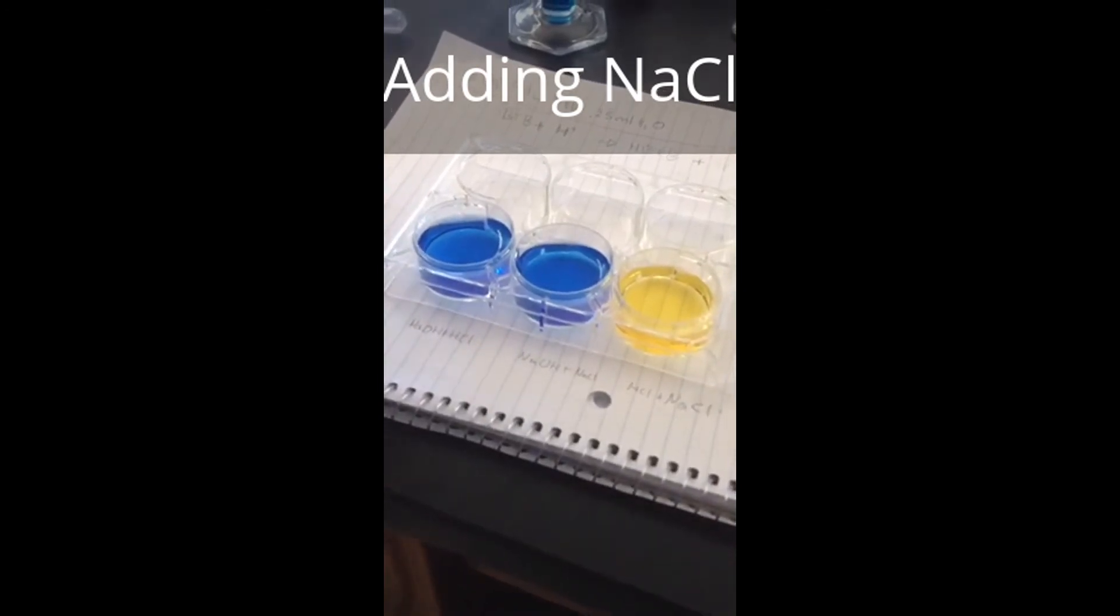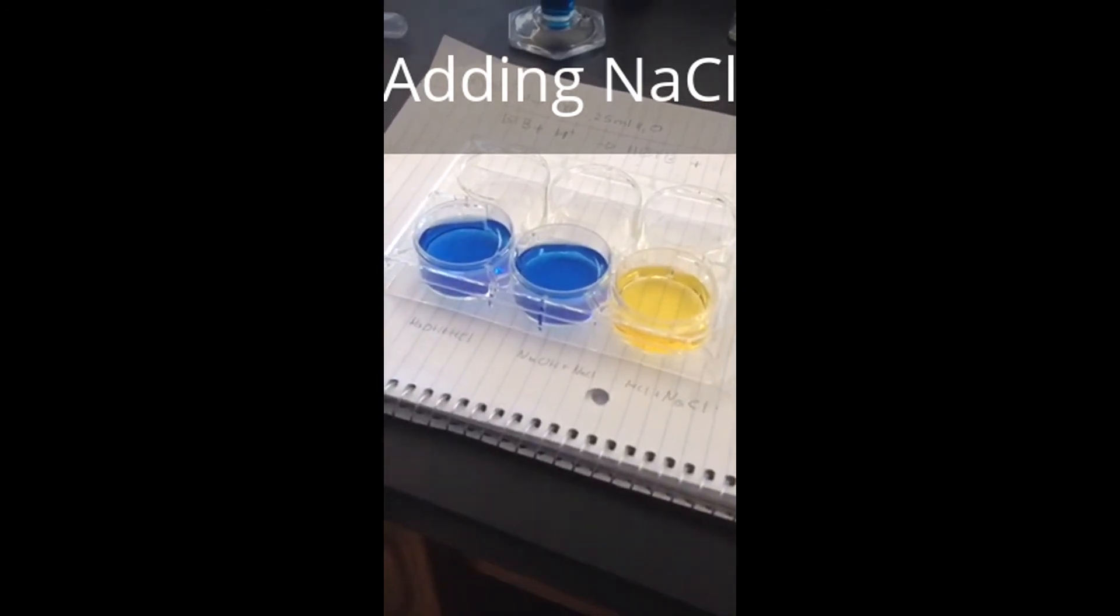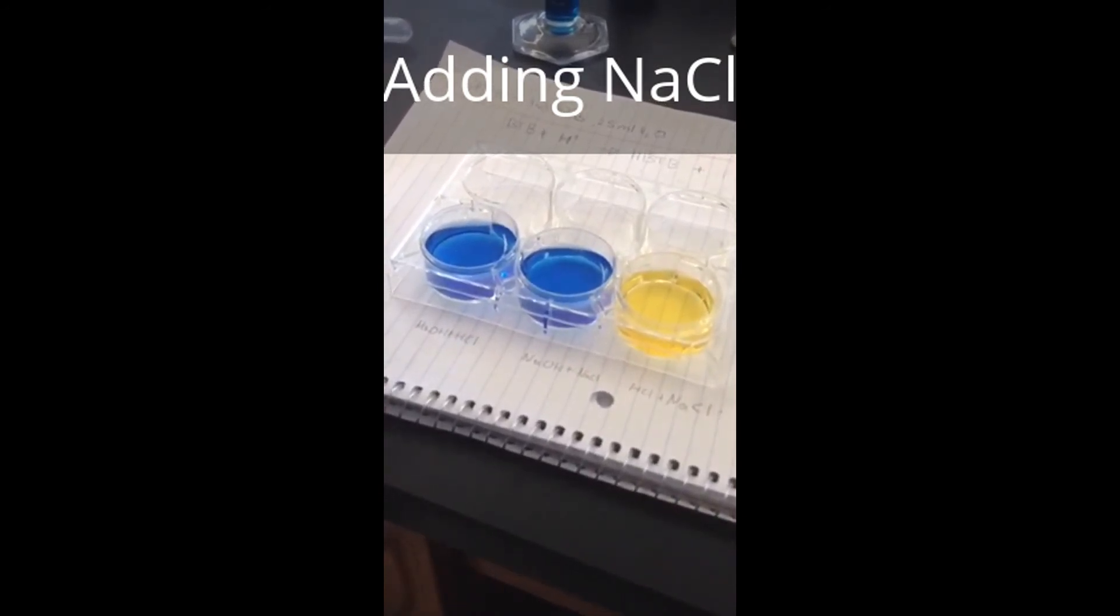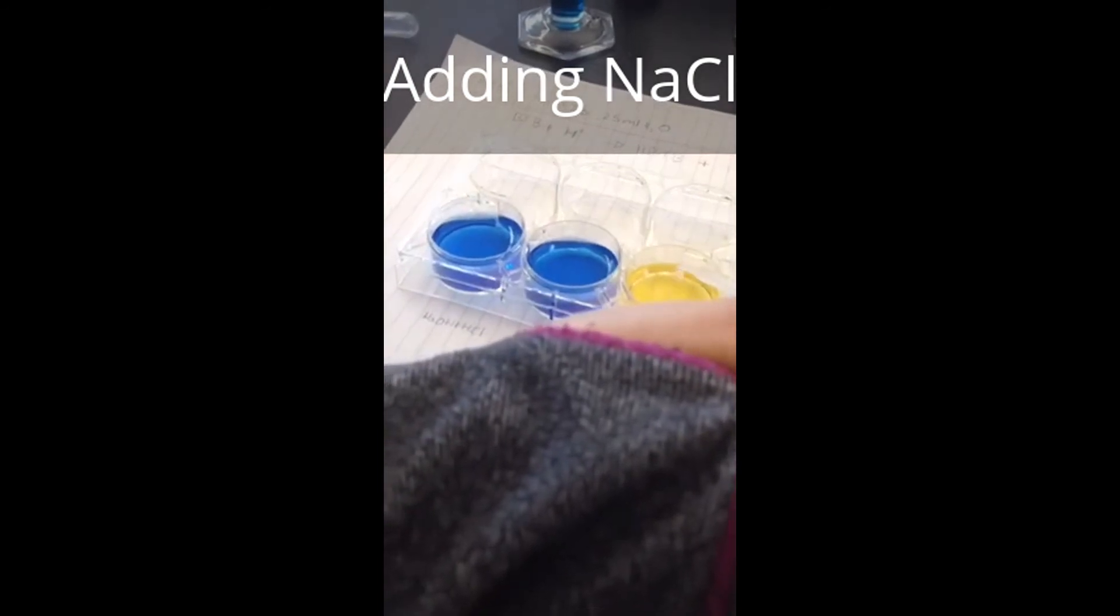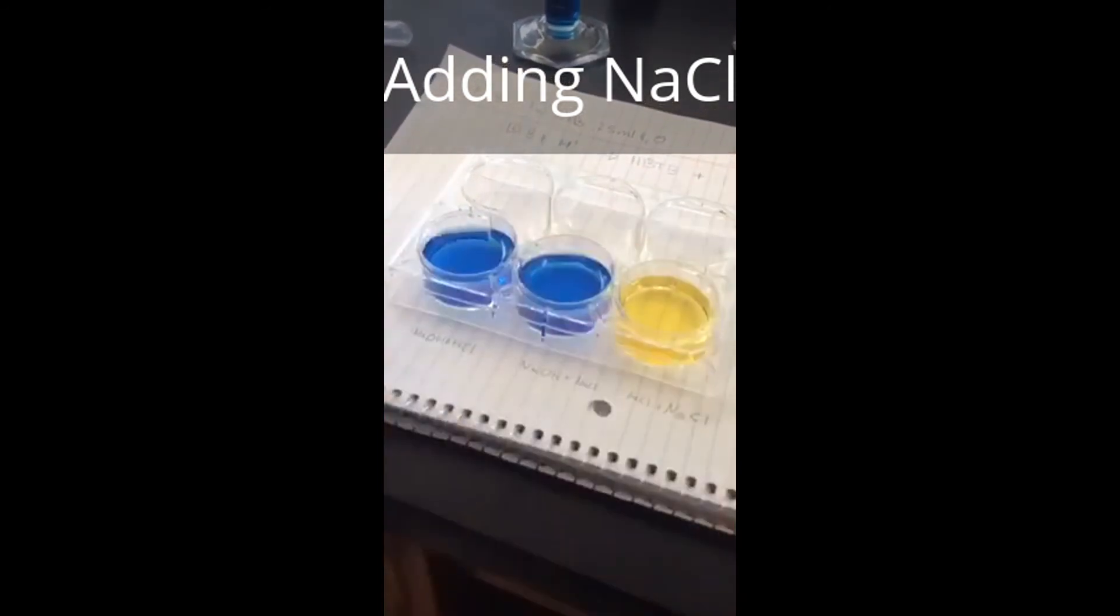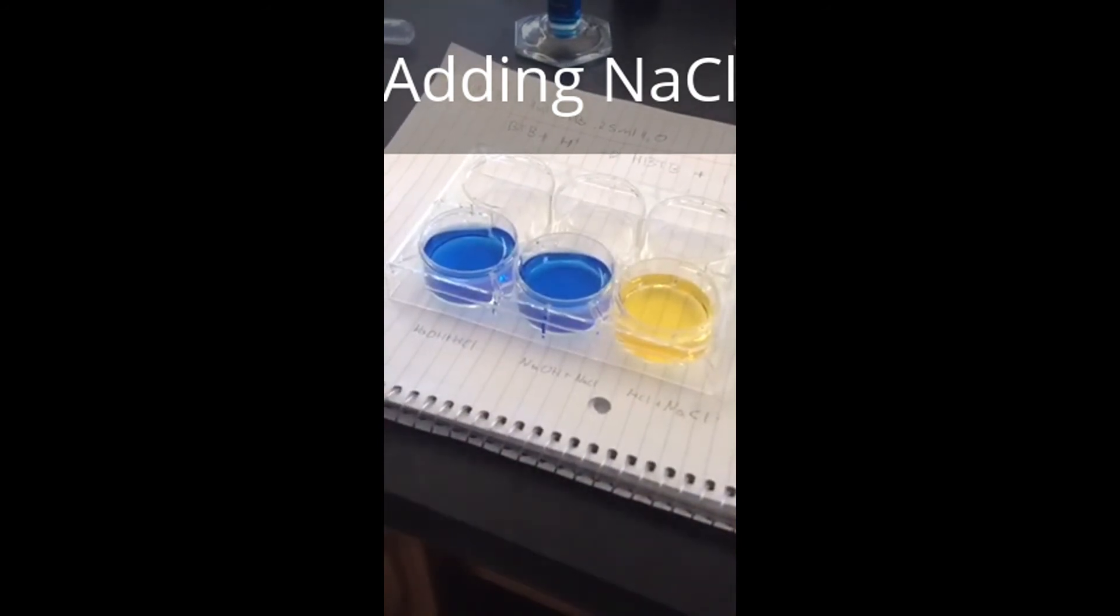Now we're testing to see the effect of a change in concentration of NaCl in the mixture of NaCl with HCl. Since NaCl is neutral, there is no change.